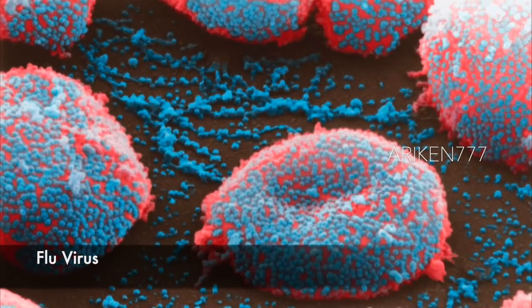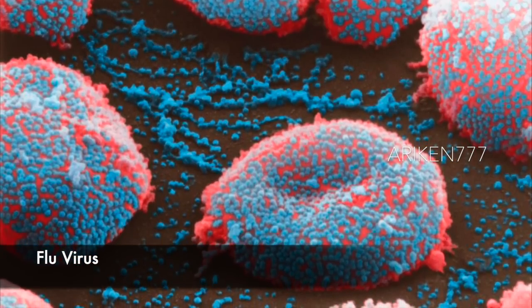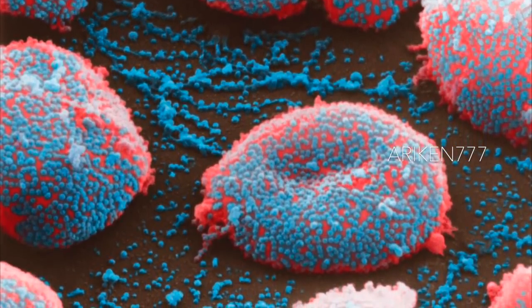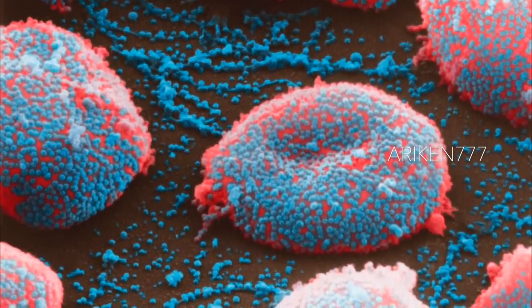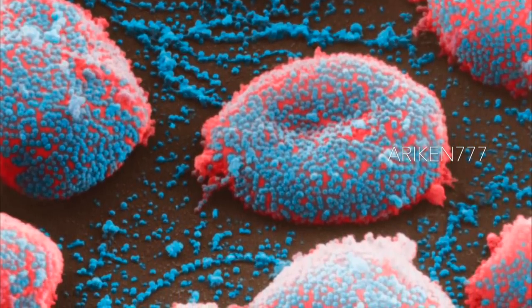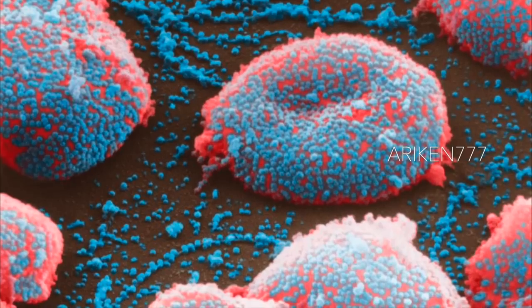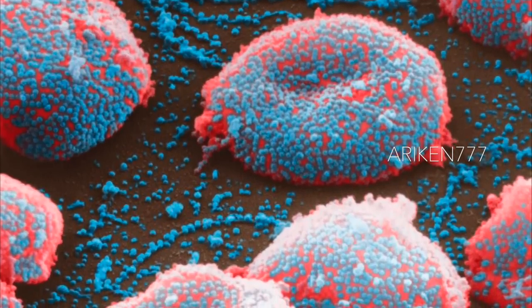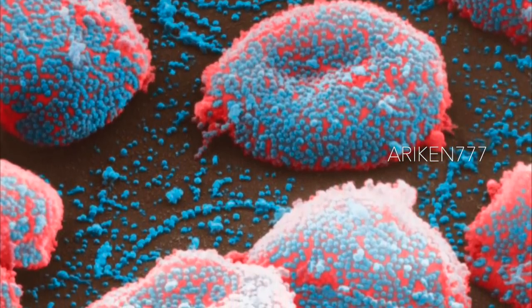Seen here are flu or influenza virus particles on red blood cells. Flu usually causes lethargy, aching muscles, fever, and nausea. Some strains, however, develop into far more serious forms, and epidemics in the past have killed millions.